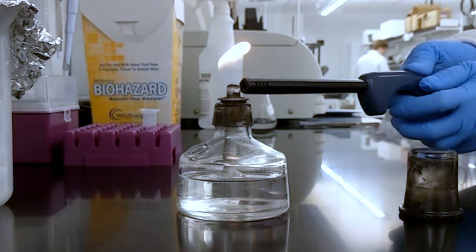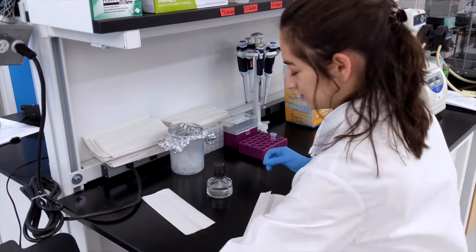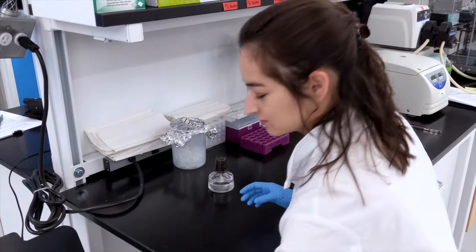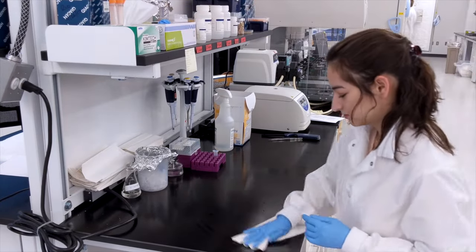If you're going to be using a Bunsen burner or candle jar, make sure that the space around the burners are free of loose papers or laboratory wipes. Finally, wipe down the workspace and pipettes with 70% alcohol and allow it to evaporate.